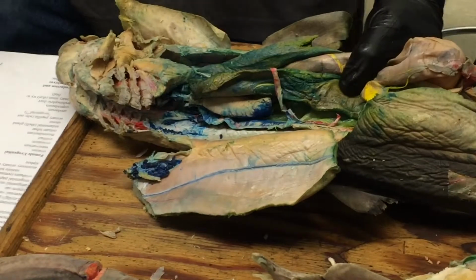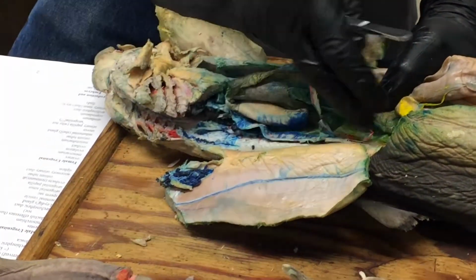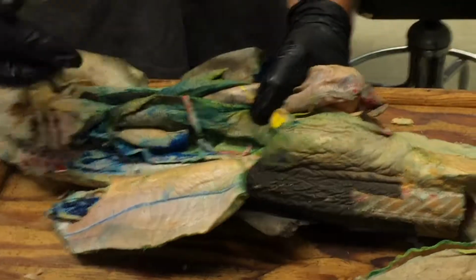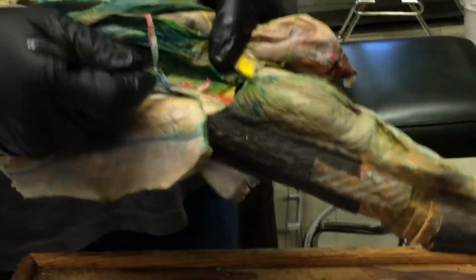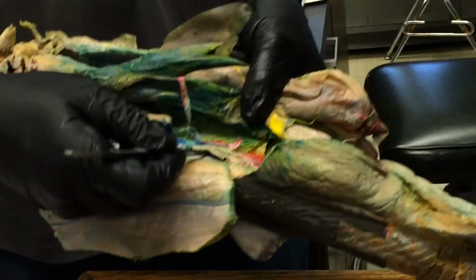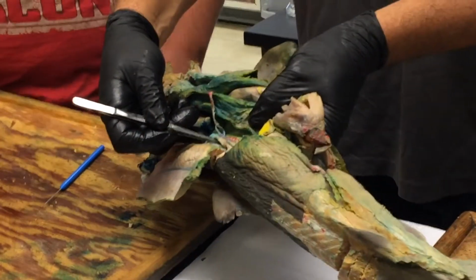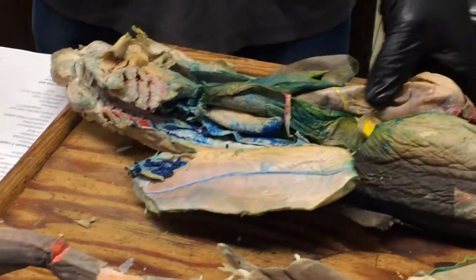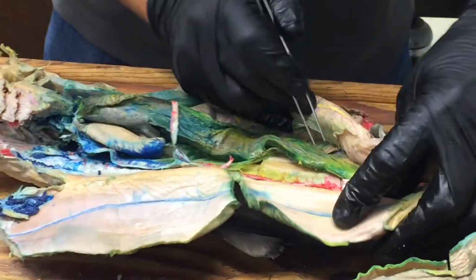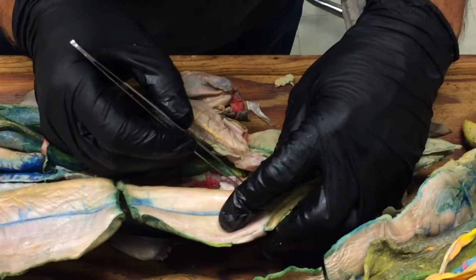So what's happening is the sperm enter into the archinephric duct from the testis. They're traveling along the archinephric duct, and then this region of the kidney that you see this archinephric duct all coiled up on, this anterior part of the kidney, is called Leydig's gland, and that's the region that's secreting semen into the archinephric duct. As you go further back, the archinephric duct expands and turns into a large sac, which again, let's see if I can just peel away a little bit more.